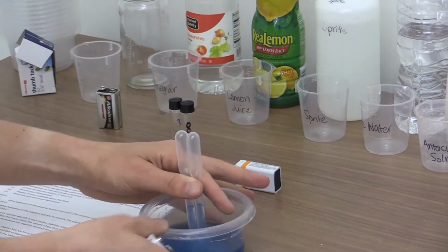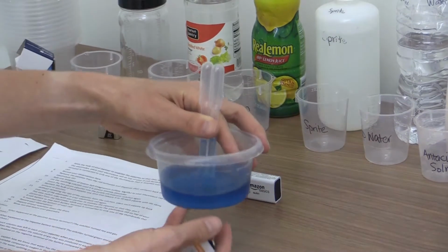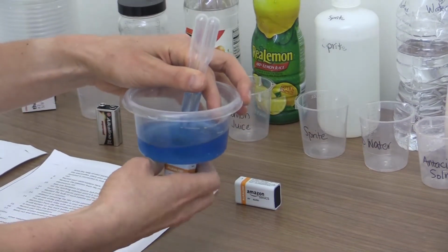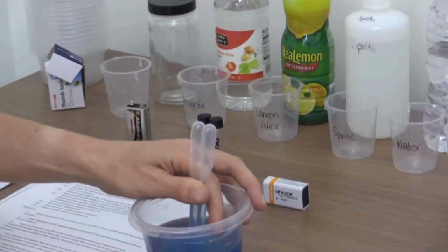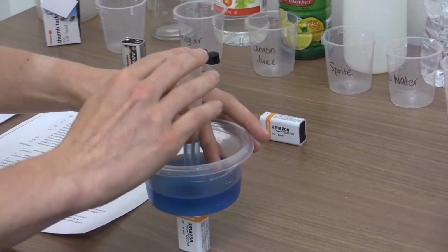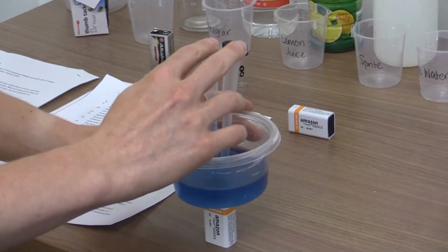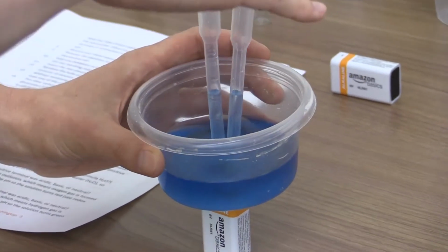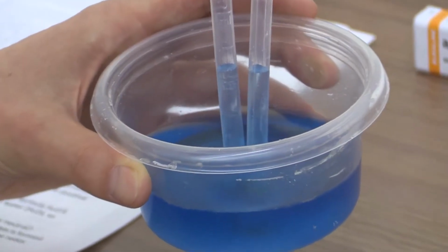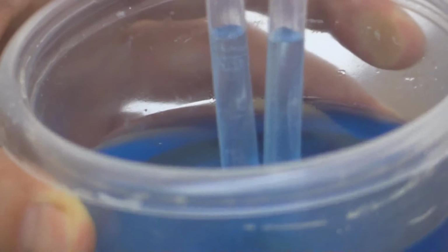And so once they have it set up this way, they're going to hold the tips in the solution, and it's kind of hard to do with one person, they normally do it with partners, they're going to place it over a 9-volt battery, so that one thumbtack is touching the positive terminal and the other is touching the negative.